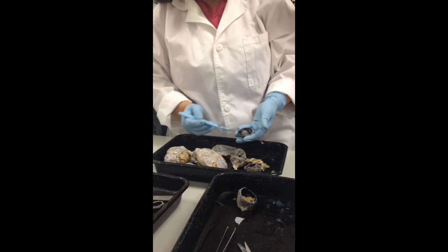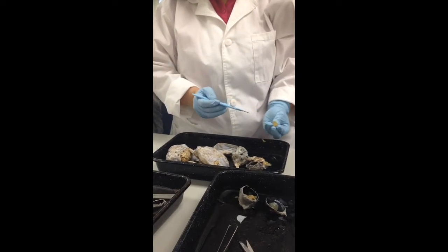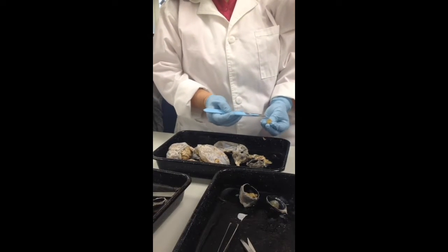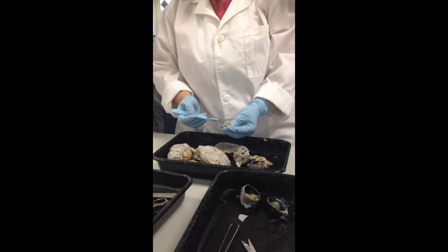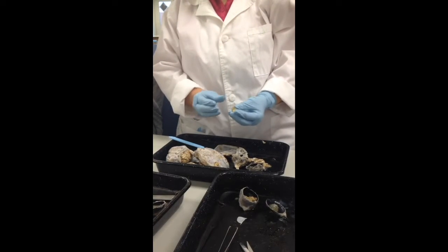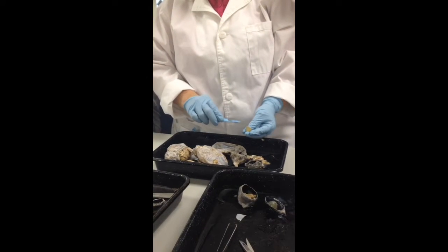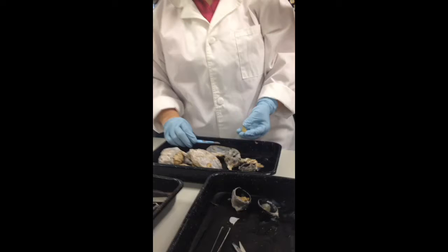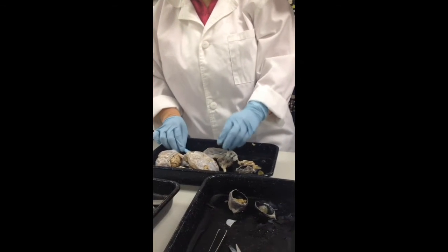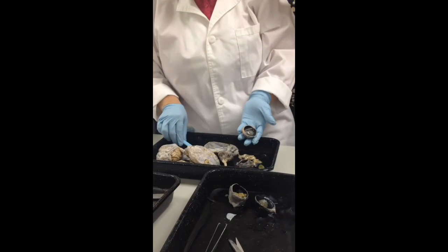Okay. If we cut the lens in half, then you can see the layers of cells that are making the lens. If this was dried, you'd see the rings, because they're in rings. Now when this is living tissue and the cells are alive, then it's a little more flexible. Right now it's really hard. Okay? This is what becomes cloudy in people that get cataracts. Okay? All right.